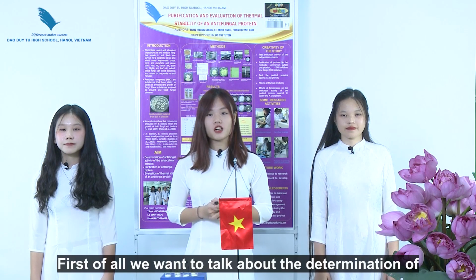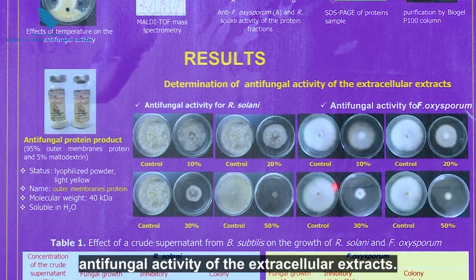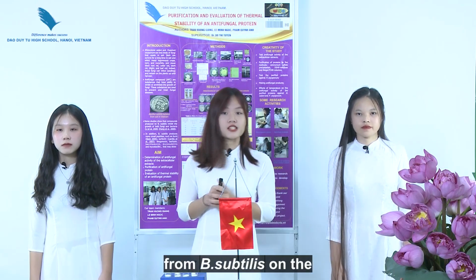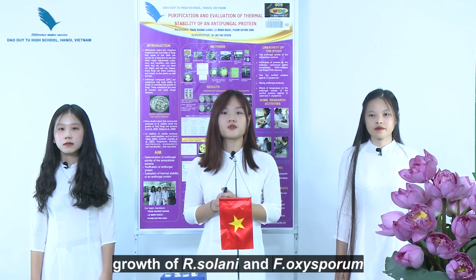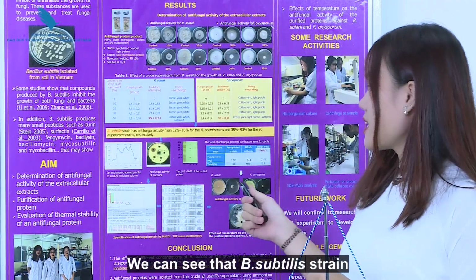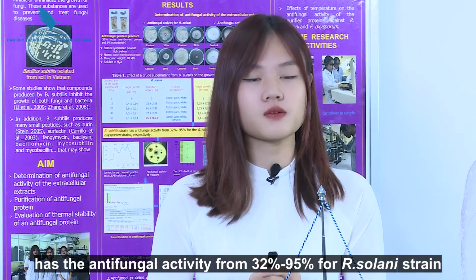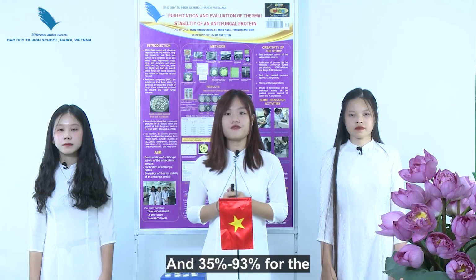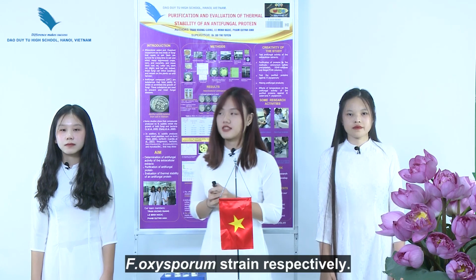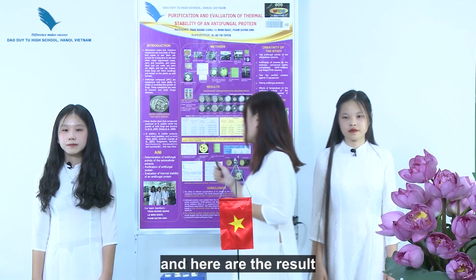First of all, we want to talk about the determination of antifungal activity of the extracellular extract, starting with the effect of crude supernatant from Bacillus subtilis on the growth of Rhizoctonia solani and Fusarium oxysporum. We can see that the Bacillus strain has antifungal activity from 32% to 95% for the Rhizoctonia solani strains, and 35% to 93% for the Fusarium oxysporum strain, respectively. After determining, we purified the protein, and here are the results.